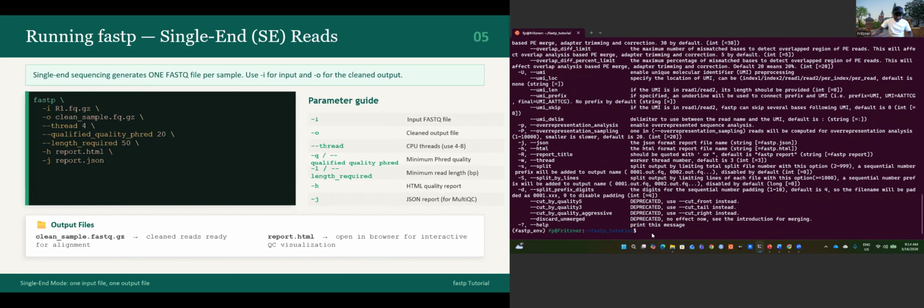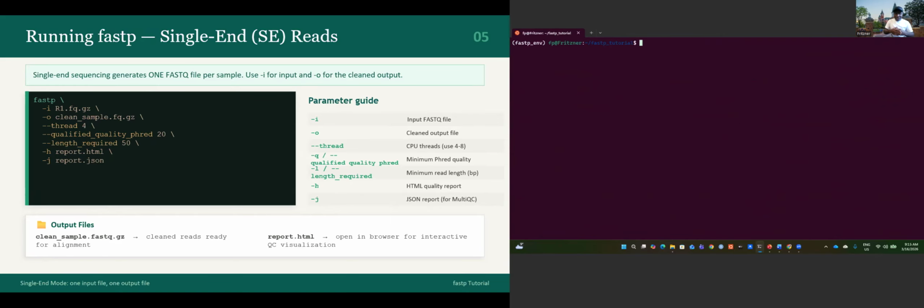Let's clear again to get more space. If you want, you can also check what version of fastp you are using: fastp --version. I forgot to tell you that at the beginning. I'm using version 1.1.0. That's good. So now let's run fastp for the single end.